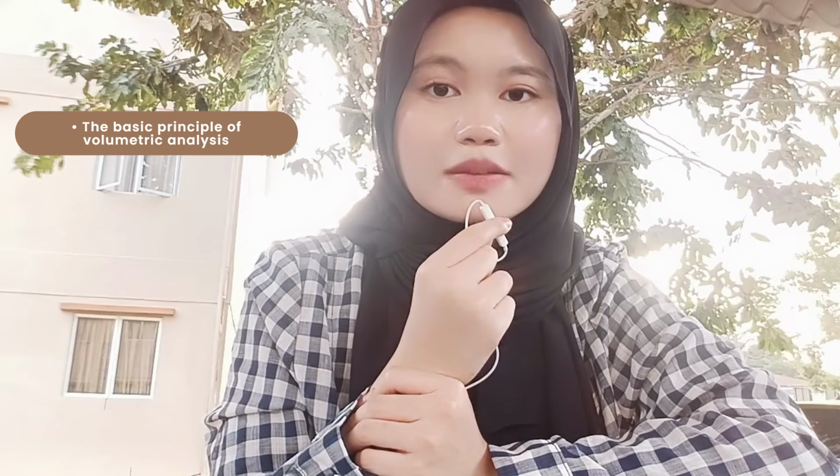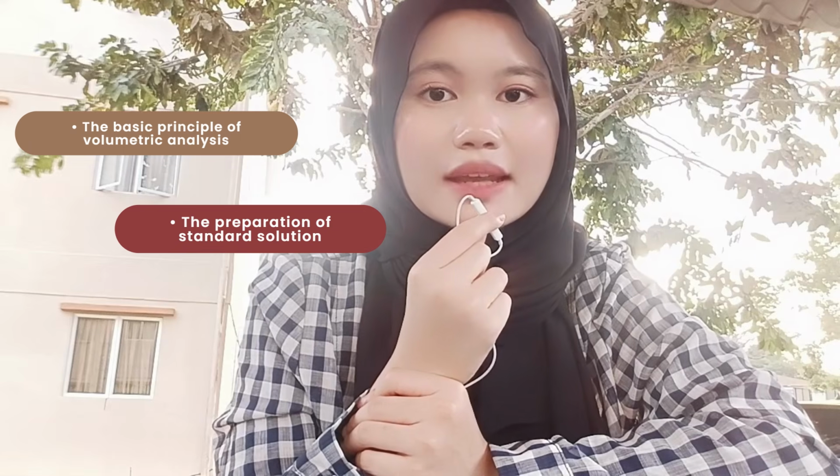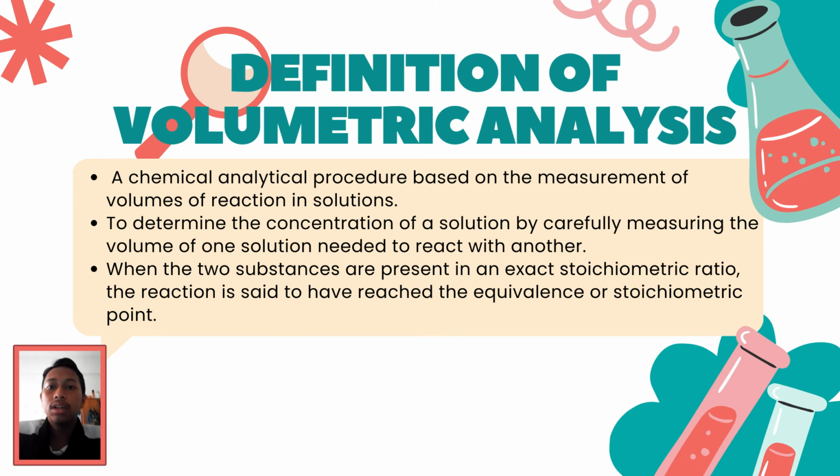In this video, we will discuss the basic principle of volumetric analysis, the preparation of standard solution, types of titration, and calculation involved in determining unknown concentration. Understanding this method is very essential because volumetric analysis is frequently used in laboratory experiments and plays a crucial role in obtaining accurate and reliable analytical results. Without further ado, let's get started. First, what is volumetric analysis?